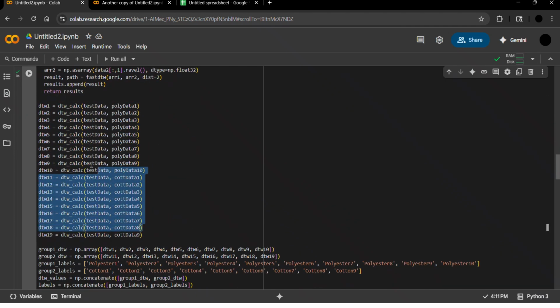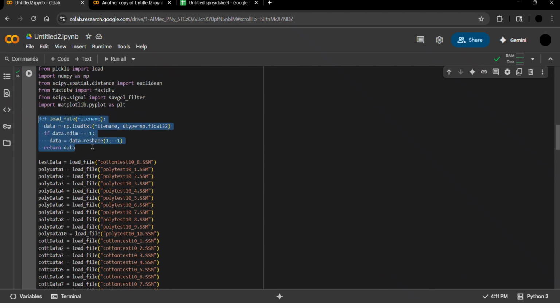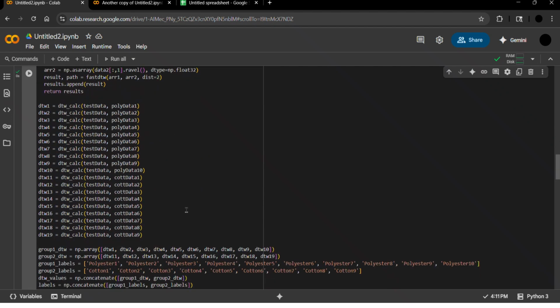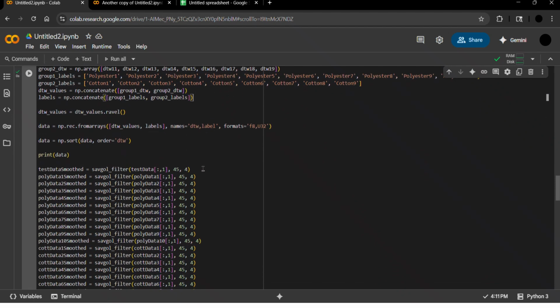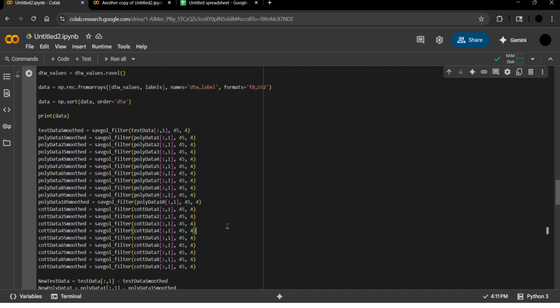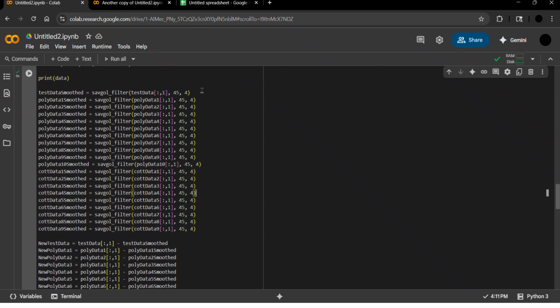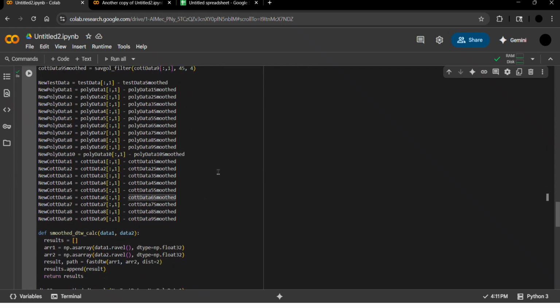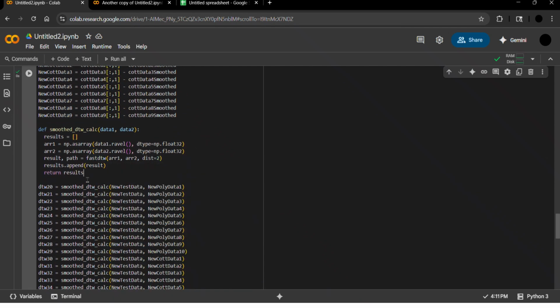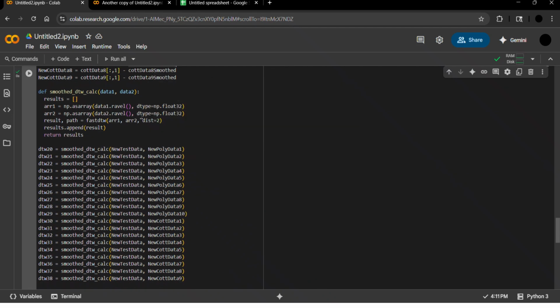This is the dynamic time warping function call, which you can see here, which will return each similarity score. Here we have the labels for each trial applied, so you can see at the end which similarity score belongs to which. Here is the beginning of the noise filtering, in which a Savitzky-Golay filter is applied for each to create a baseline of noise and fluorescence, which is then subtracted from the data at each trial, which you can see here. And then this is the second dynamic time warping function call, which is used because the dimensions of the data have now changed, which you can show there.